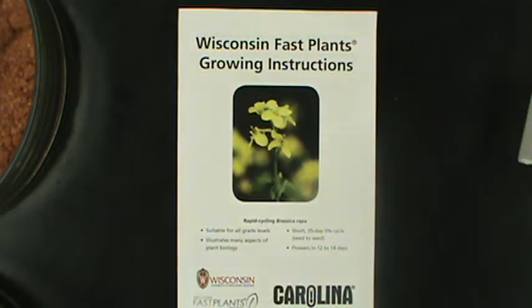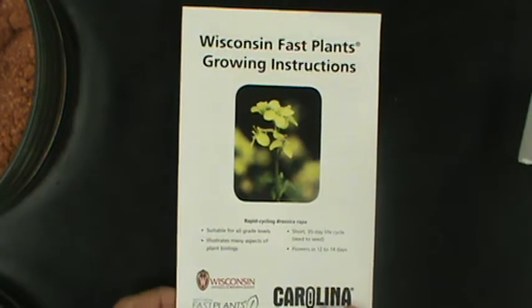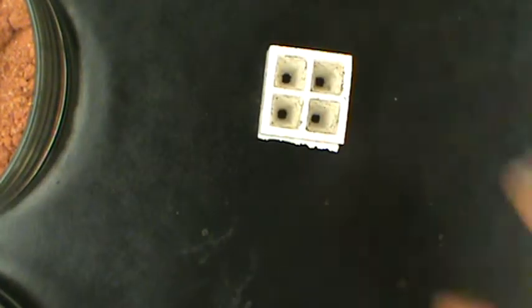The Wisconsin Fast Plant System is a great way to test the nutritional needs of plants. This system will allow us to grow plants in a very short period of time. However, in order for this system to work, we have to follow very specific instructions on how to plant our seeds.